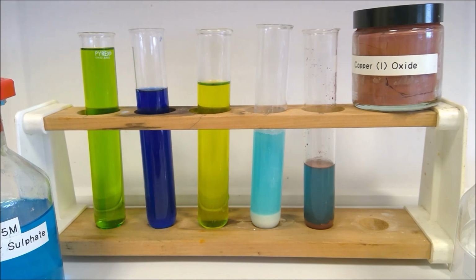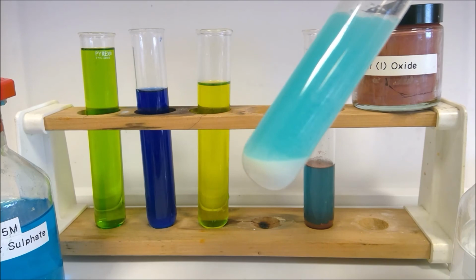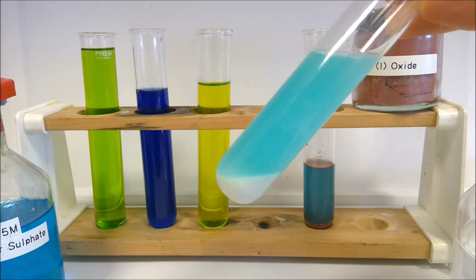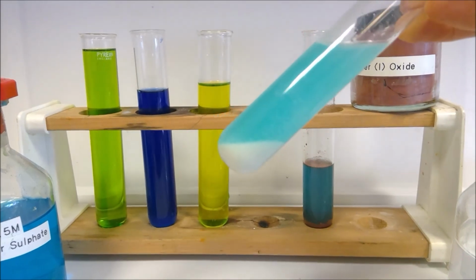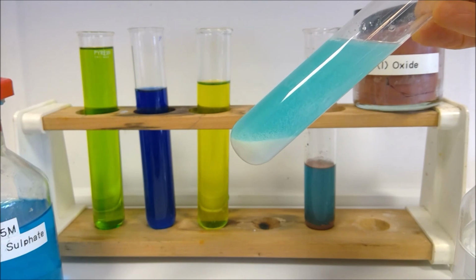So this was the one where we added our potassium iodide. It went all kind of brown and murky, and then we added the sodium thiosulfate. So after standing, we can now see clearly what the colour of our precipitate is. Sometimes it's quite hard to tell the colour of a precipitate while it's all mixed up in a coloured solution because it appears to take on the colour of that solution. But now it's settled down at the bottom, it'd be worth just revisiting your observation for the precipitate there.